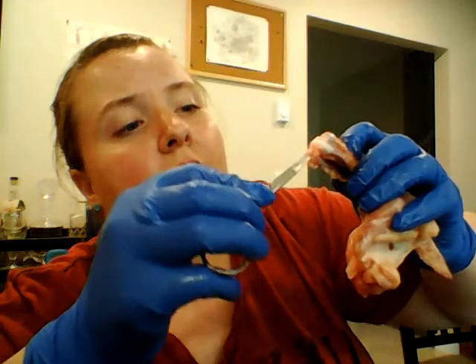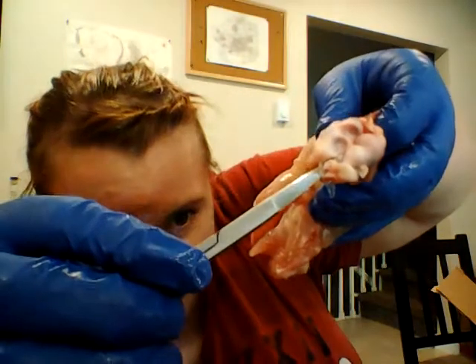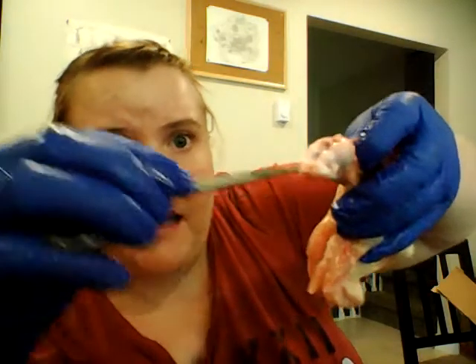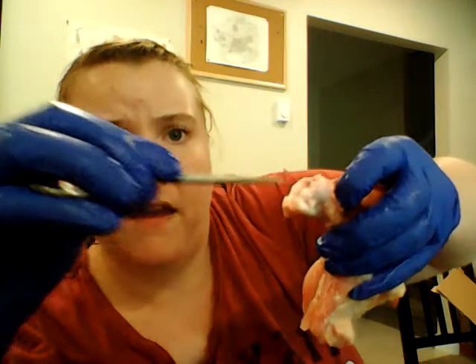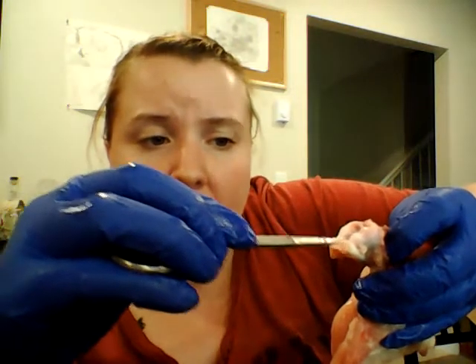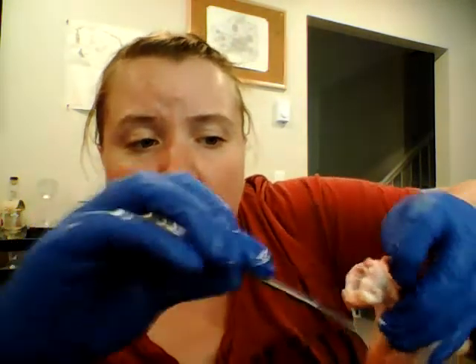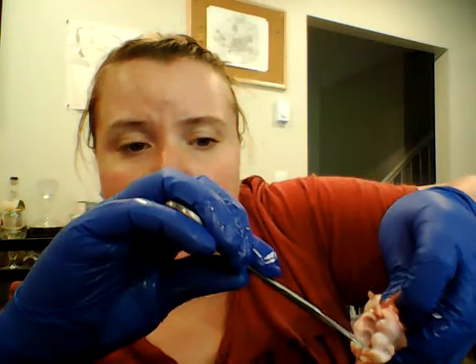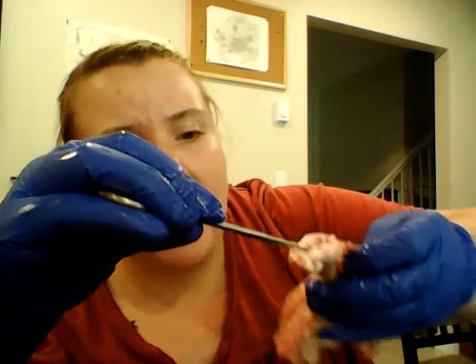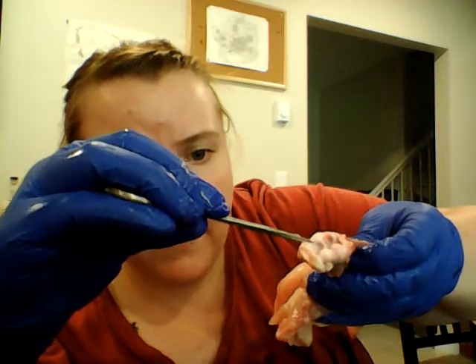This little part here, if you could see that, is the synovial membrane, and that outlines the entire thing. And on the outside here, the major part of the outside of the joint is the articular capsule. That looks like a big fatty piece, but it's not. It's cartilage. And then on the inside here, we have these two little circle things.